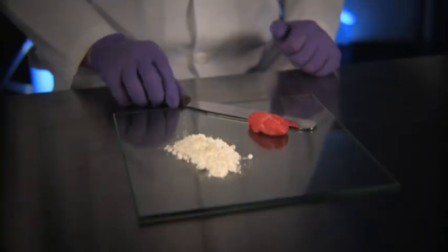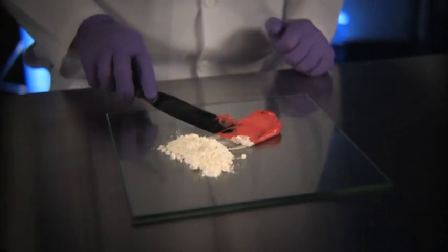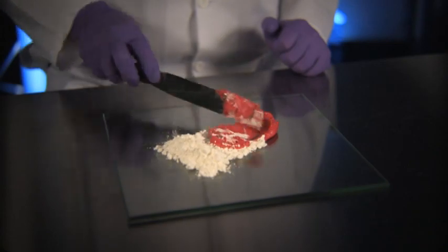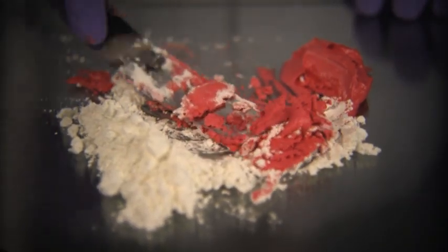The primary tools used to prepare creams, lotions, pastes, and ointments are a compounding slab and a spatula, used to mix the medication into petroleum or lanolin-based products, such as Vaseline, Aquaphor, or Eucerin. The result is a smooth, appealing preparation for the patient.